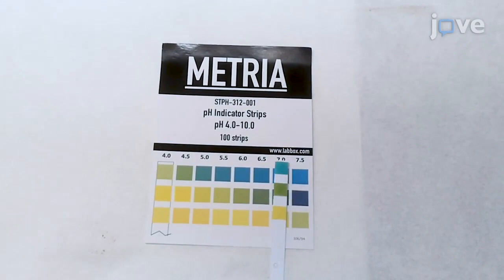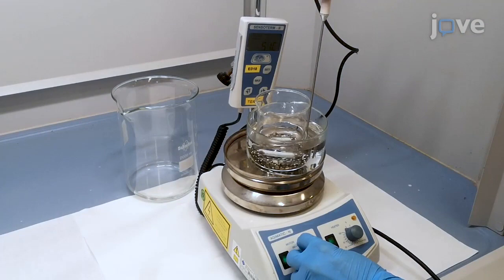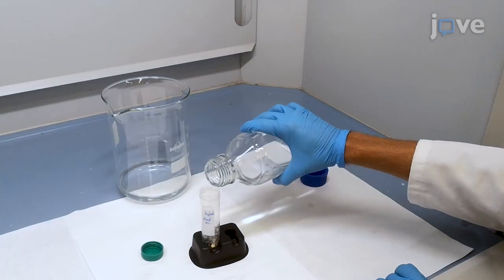Repeat the sonication and incubation process as explained earlier by replacing sodium hydroxide with 50% nitric acid. Perform the washes and sonication with deionized water before storing the implants in a 70% ethanol solution.